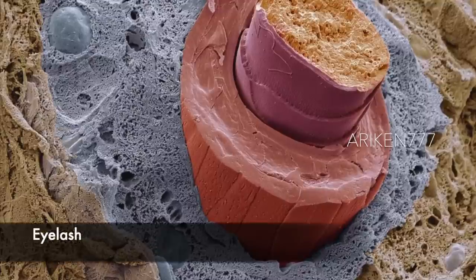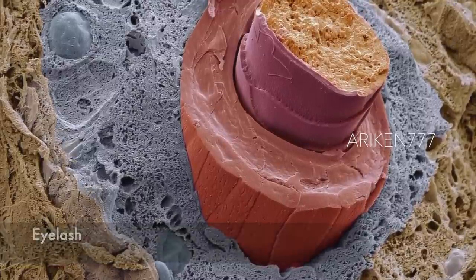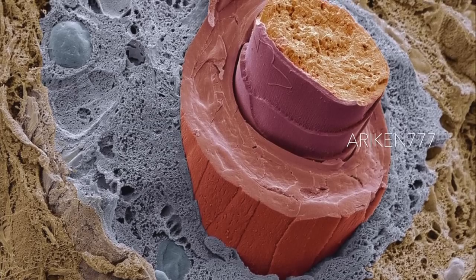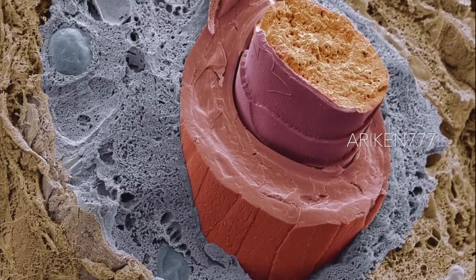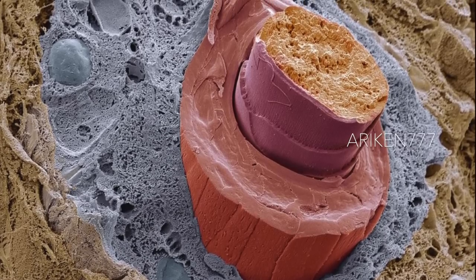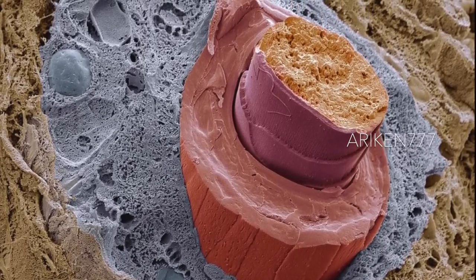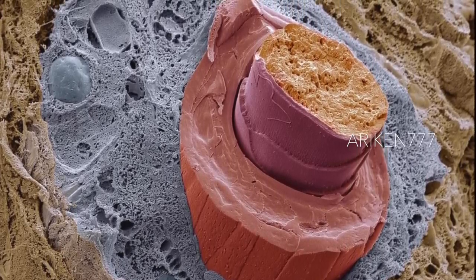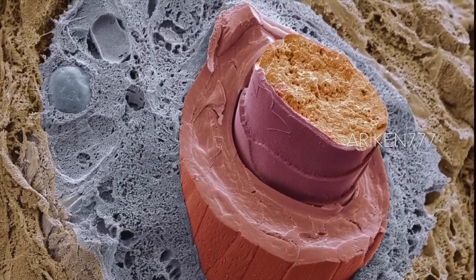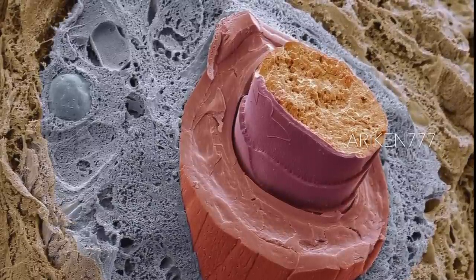This is a broken eyelash hair. The hair in purple is growing from a follicle in the underlying layer of skin surrounding the eye. The portion of the hair protruding from the skin is made up of dead tissue and the protein keratin. Eyelashes protect the eye from debris. They are sensitive to being touched, thus providing a warning that an object is near the eye, which is then closed reflexively.